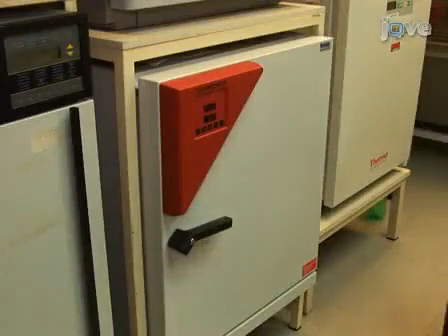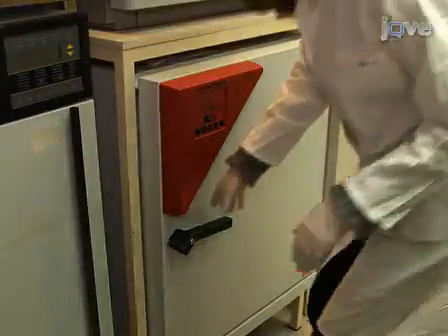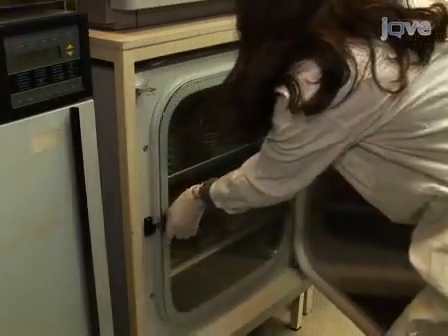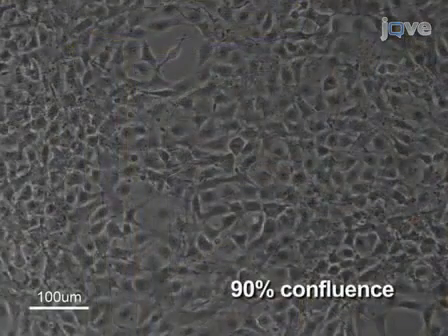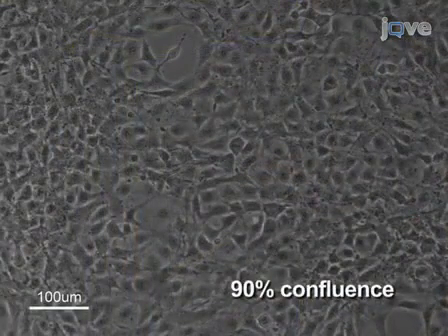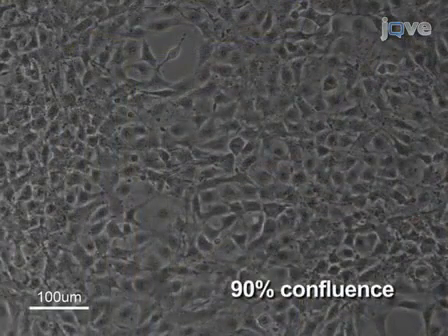To begin this procedure, use NIH 3T3 cells grown overnight in one 90mm dish for each sample. The culture is sub-confluent.